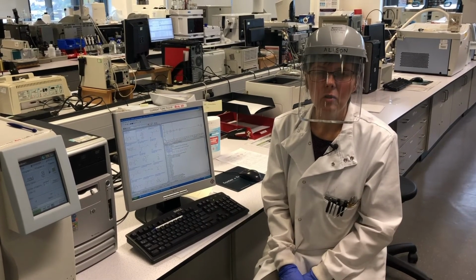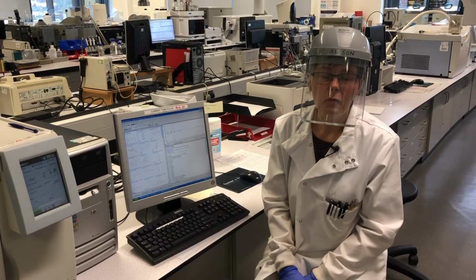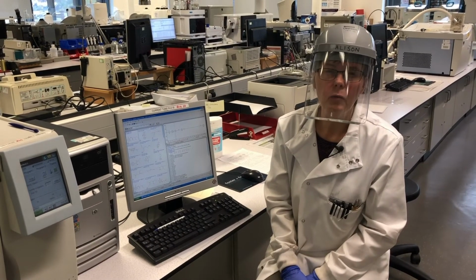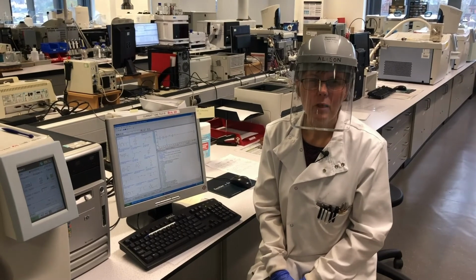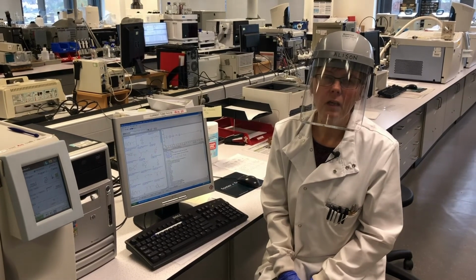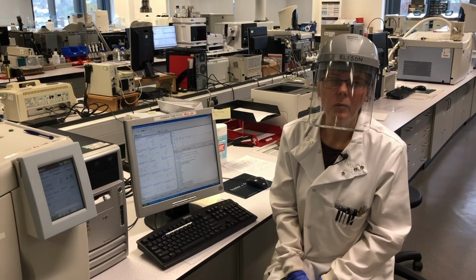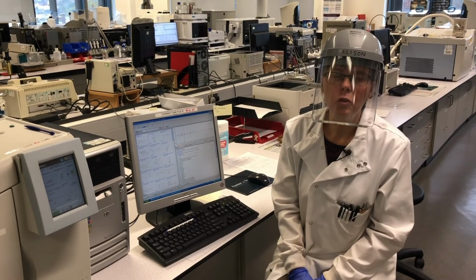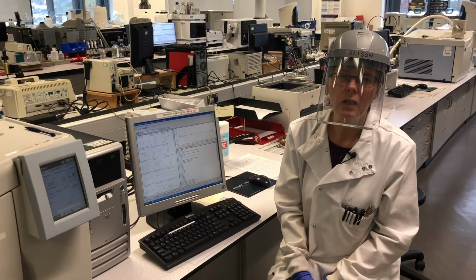This is important research, and here at Staffordshire University we have a number of research projects which might involve, for example, collecting samples that have been handed into the amnesty bins at a local festival, analysing them to see which trends we can discover. We also have researchers working with local prisons. The focus here is not so much drugs like cocaine, but rather the new psychoactive substances, things like the spice that you may have heard about. And we're working closely with our local prisons to identify some of those new drugs which we've never seen before and which we need to be on the lookout because they have such a devastating effect.